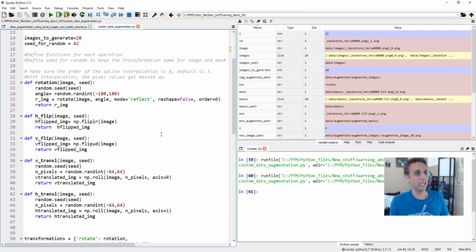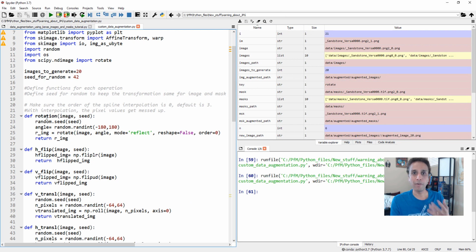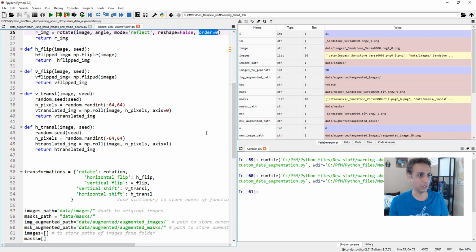By the way, I'm doing random rotations, but I set order equal to zero. Again, I talked about this in the last tutorial. What that means is that when you're rotating the matrix, do not do interpolation between the data points. That's what probably was going on with Keras, and that's why the issues with Keras, in case you haven't watched the previous tutorial.